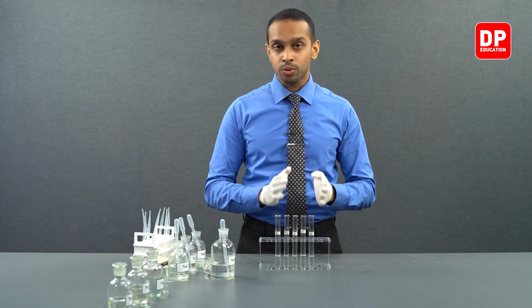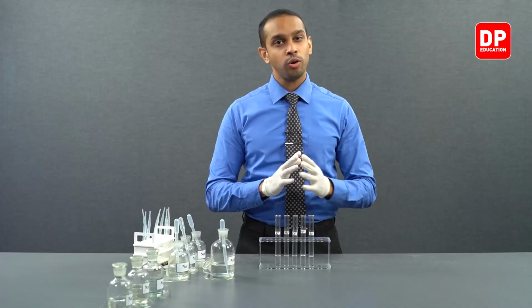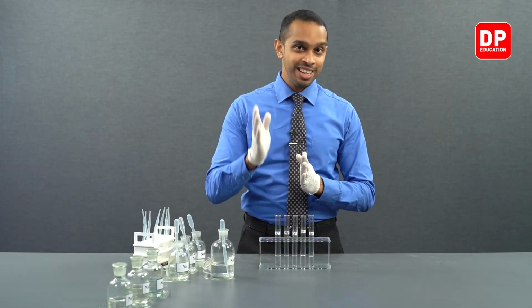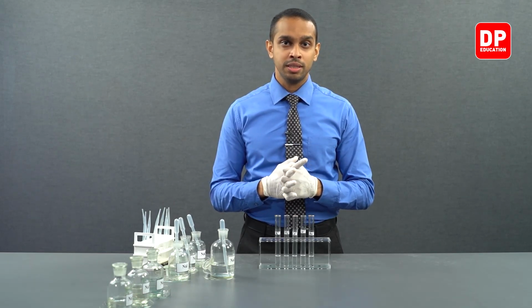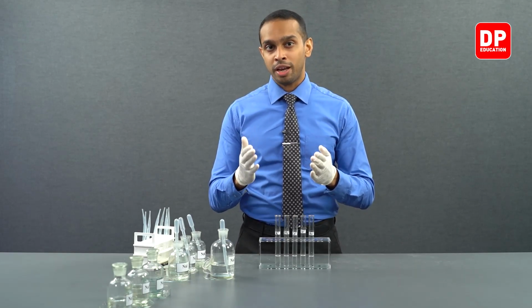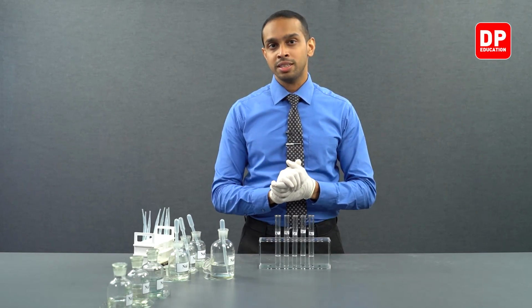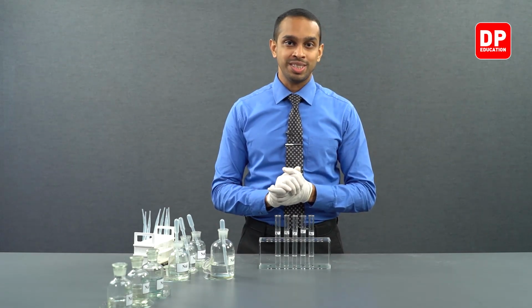However, group 2 cations, when reacted with hydroxide ions, will not always form soluble salts. Solubility of the group 2 hydroxides increases down the group, and solubility of group 2 hydroxides such as magnesium and calcium are actually not that high. That means they will form precipitates, but as you go down the group 2 hydroxides start to become more and more soluble. Let's see if we can make that observation here.